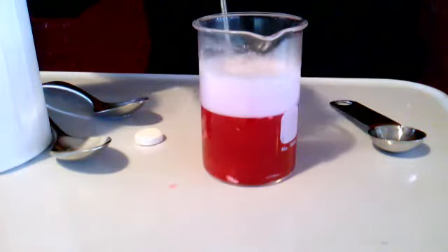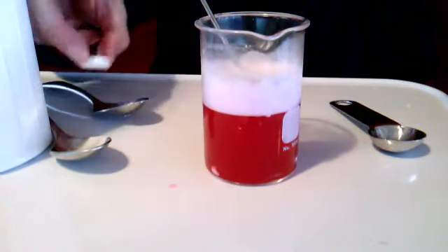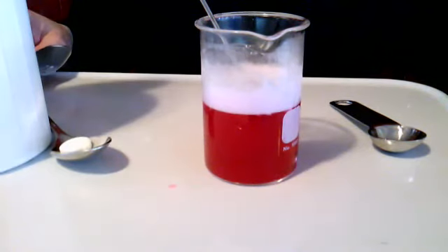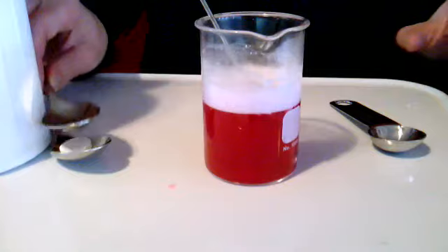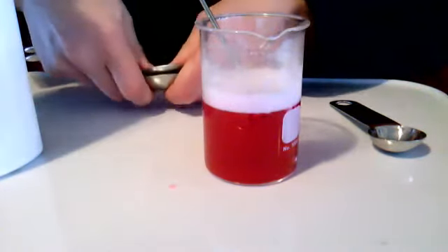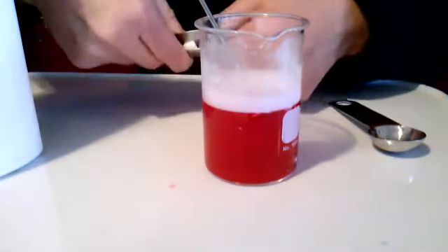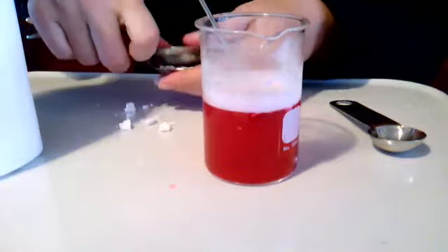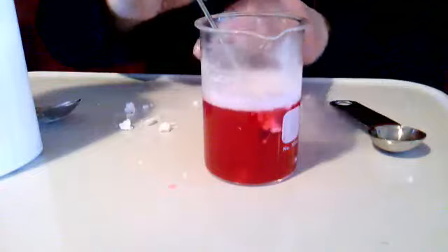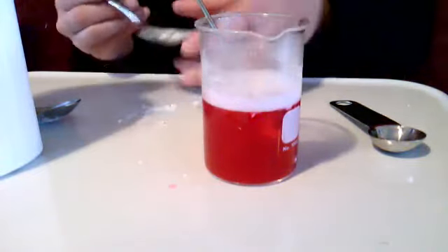Okay, so this poor person is still very, very pink in the stomach. They are not happy. So we're going to give them another one. Usually on the box it tells you, actually I can read it for you, take 2 to 3 tablets. So at this point I've only given them 1 tablet. This would be like some young child who needed to take one. These are also a great source of calcium. Okay. And so I'm just pretend crushing it right now with my non-existent teeth because I'm not putting this in my mouth. And I'm going to put it back in the rest of my chunks. If I can get as much of these tablets in there as I can.